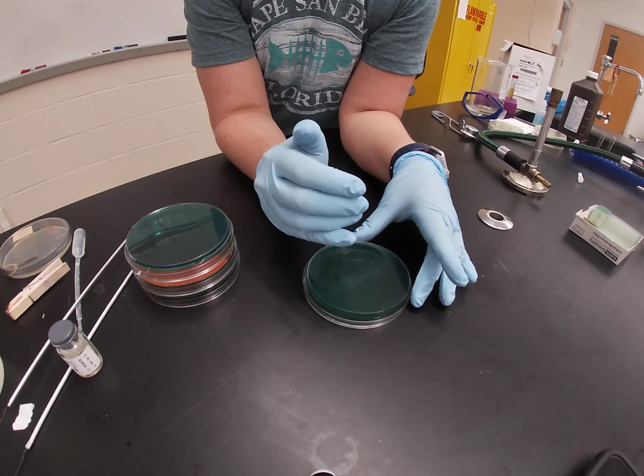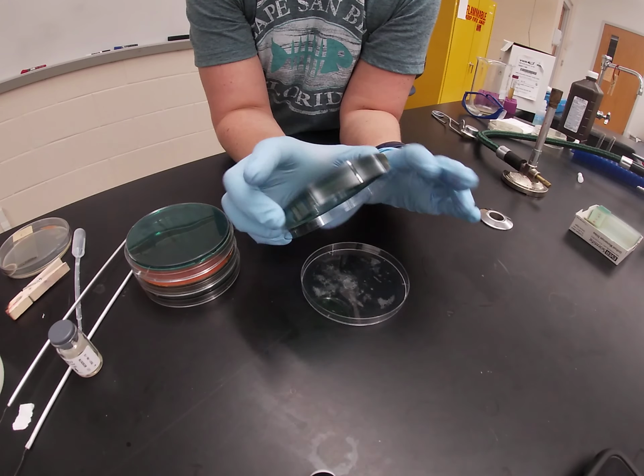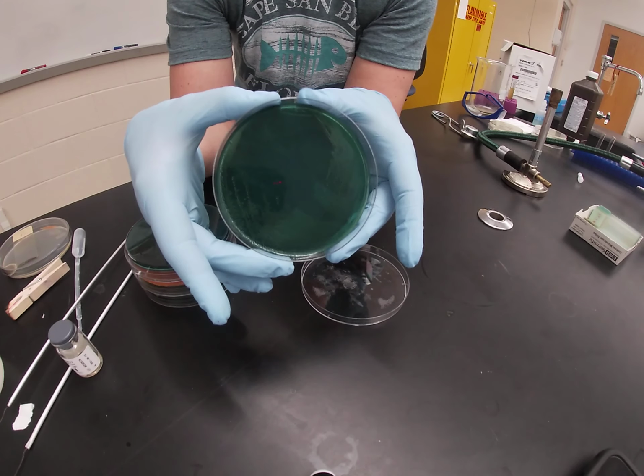Organisms that are gram-negative can grow on this agar, but that can't produce hydrogen sulfide or ferment sugars. They grow clear and really just look the color of the plate, which means that they look kind of green in growth, which is hard to see right here in this.